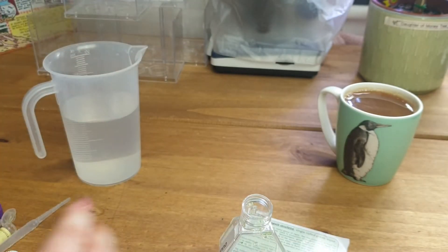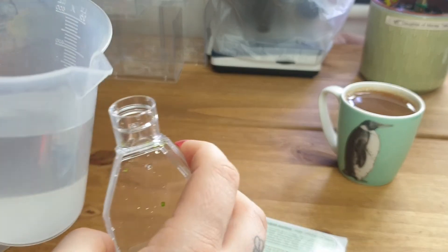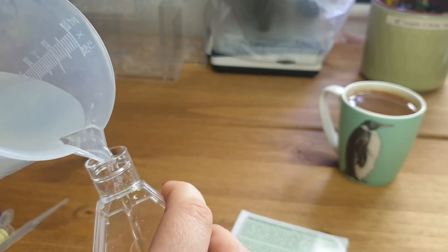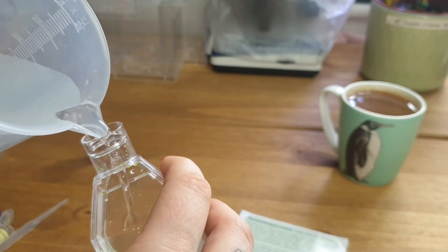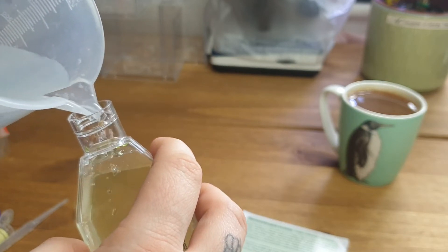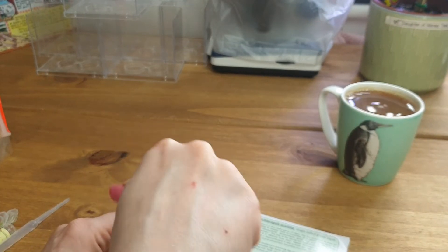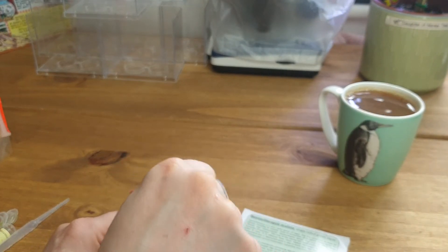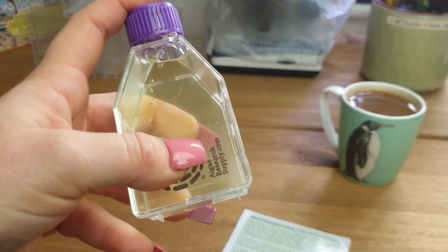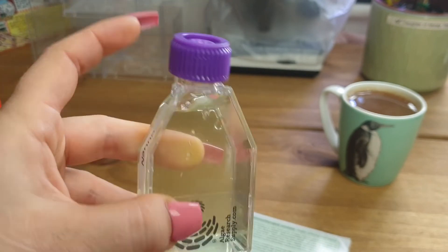I'm going to add a little bit of culture medium just to clean my pipette off. Then we have the growth nutrient, which I'm going to add one mil of — it's exactly like adding fertilizer in your garden. Pop that straight in there, and then we're going to add the culture medium, which as I've said is salt water.